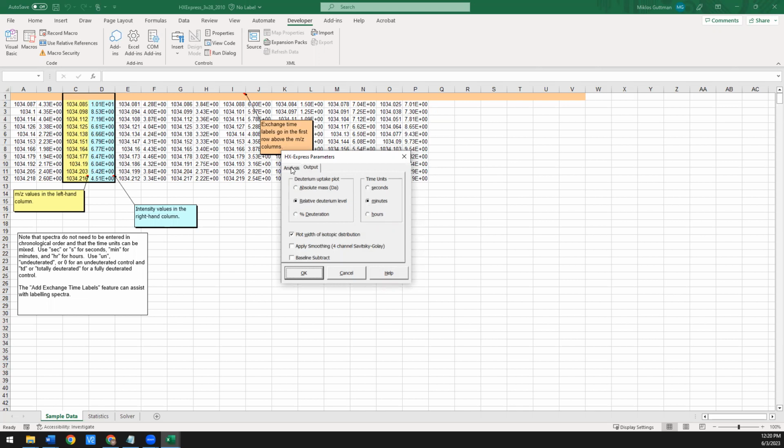And then in the analysis tab, here you have to specify the charge state of your peptide. In this case, I know this is going to be a 2+ ion. The distribution width is how wide you want it to look when it looks through the isotopic envelope, or how low in percentage intensity it's going to look. And you do want to use the isotopic peak detection for this step. If you want more information about these parameters, you can look at the very first HXExpress paper. I think it was from 2006, and it describes all these parameters.